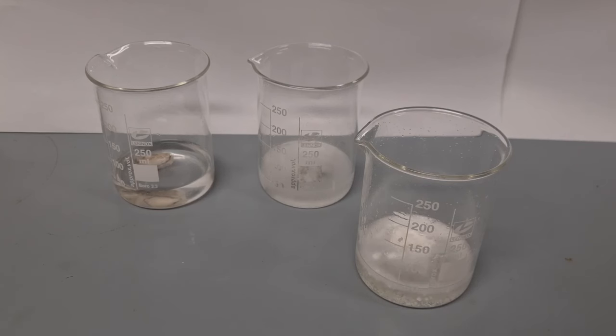And now we can hear that the reaction rate is slowing down. It's beginning to stop bubbling.